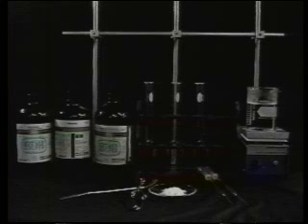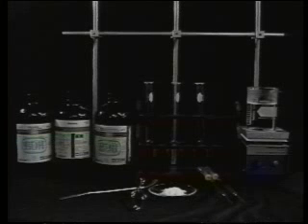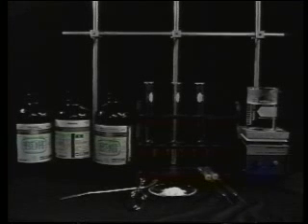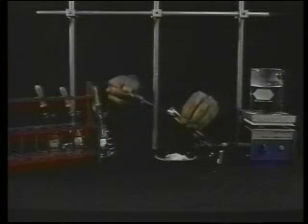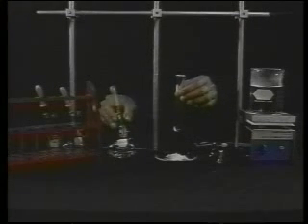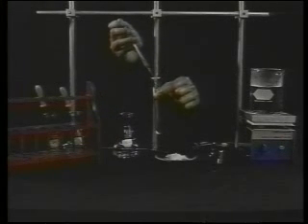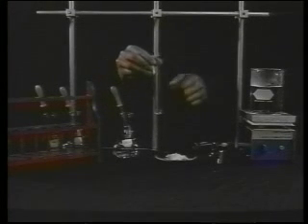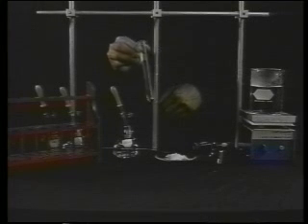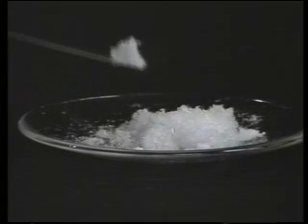You will need the solvents, test tubes and a rack, a test tube clamp, pipettes and bulb, a spatula, your compound, and a beaker of water on a hot plate. Place a small amount of solid in a test tube. Add about one milliliter of test solvent. If the solid dissolves immediately at room temperature, the solvent is not good for recrystallization.